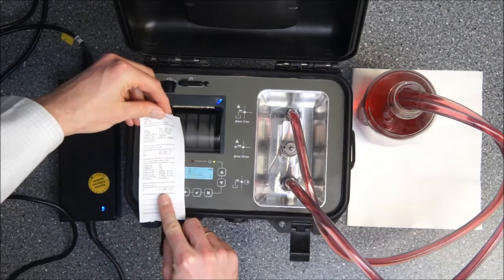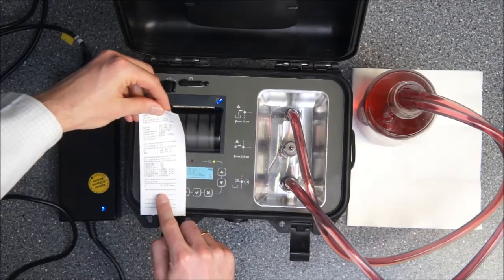As we are currently measuring in pump mode there is no pressure at the high pressure inlet. Oil is okay.